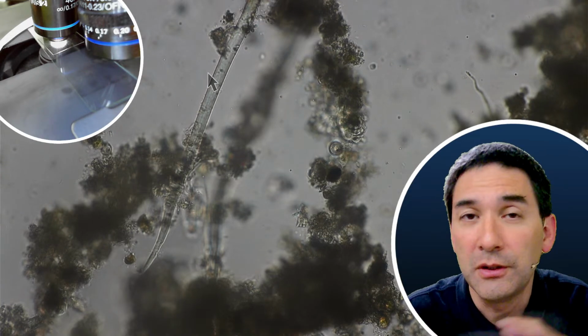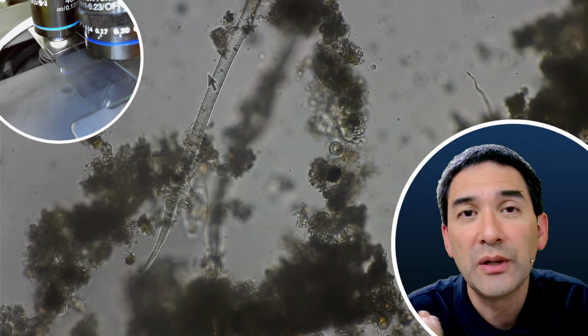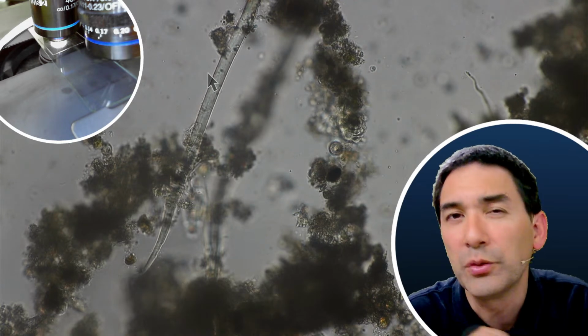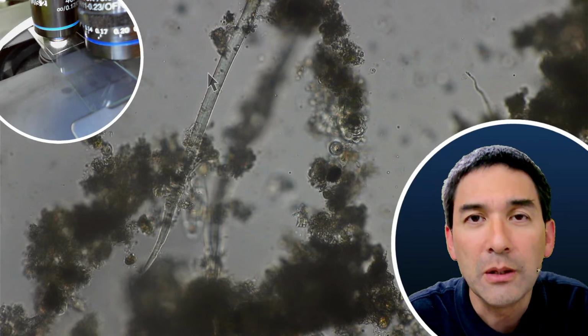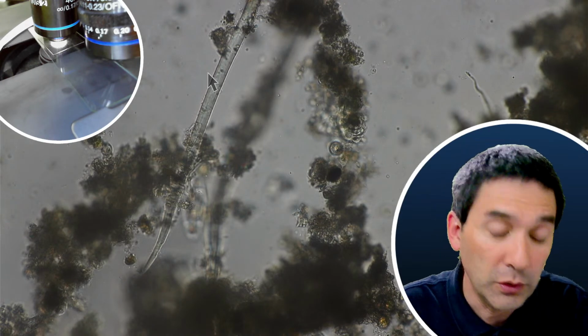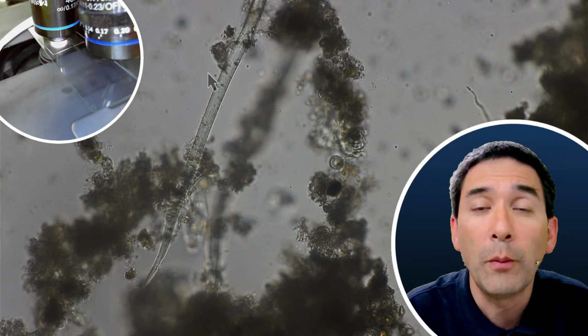I simply keep it dry to quickly scan it to see what's there. And if I want to get a better quality, then I add water. And if I want to then mount it, I'm not mounting dust so often, occasionally I am, then I'm using some mounting medium. If you want to make permanent mounts of dust, then I recommend the following, because it can be quite interesting. Over the seasons, over the months, the dust composition changes.